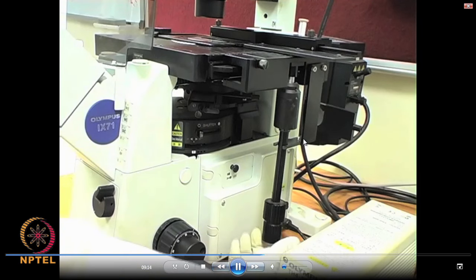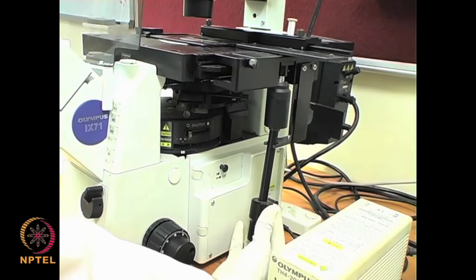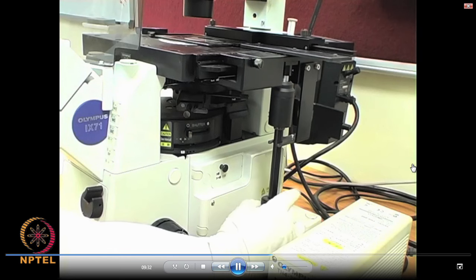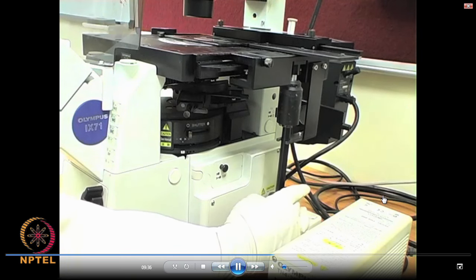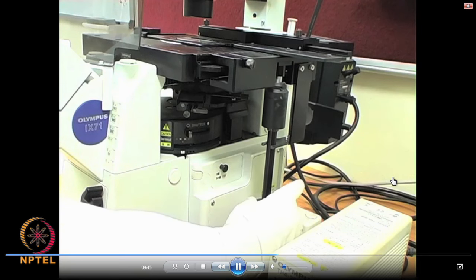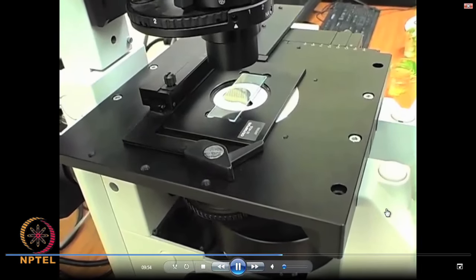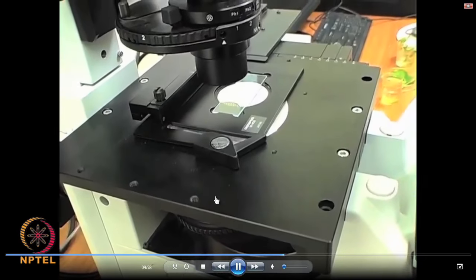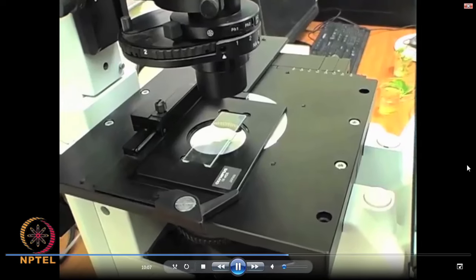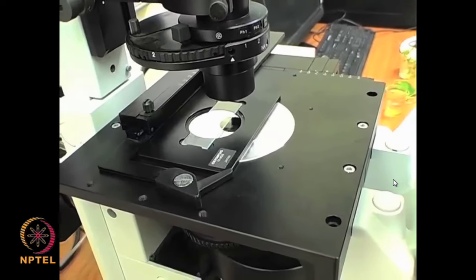This is the specimen stage which can be adjusted in x and y movement — with this knob you can clearly see the x and y movement. This is done just to give you a feel as if you are actually in the laboratory operating this microscope. I will also give you actual experiments so that you will have a complete understanding of the operation of this equipment. The whole specimen stage is being adjusted; this is another axis movement.